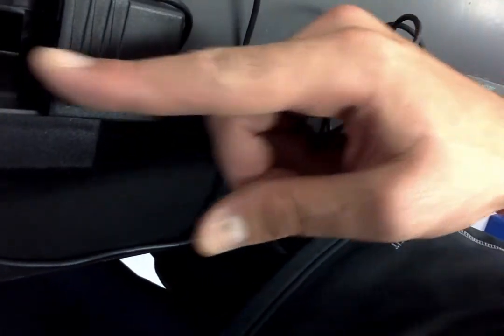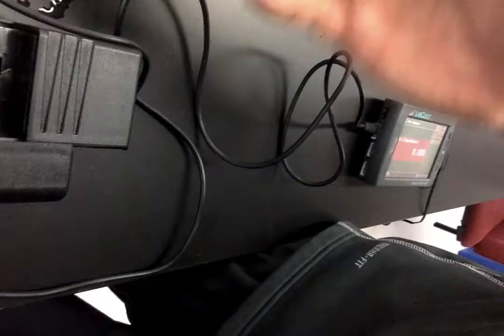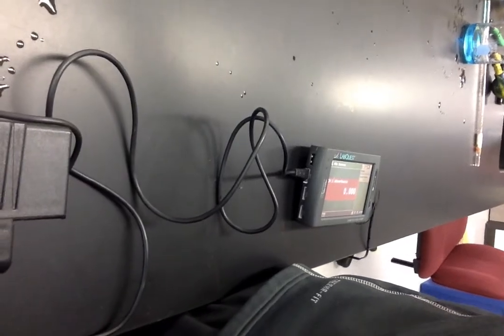And how does this device work? Inside of this device, there's a light that is shining through. You probably can't see the arrow, but a light is shining through, moving in this direction. If there's something interfering with that light, the light or some of the light will not make it through to the other side. Hence, that light is being absorbed.